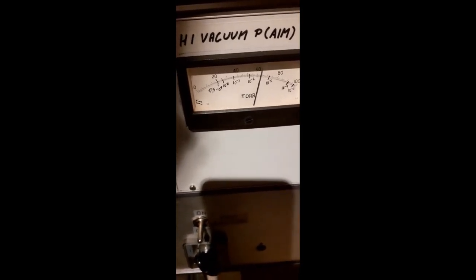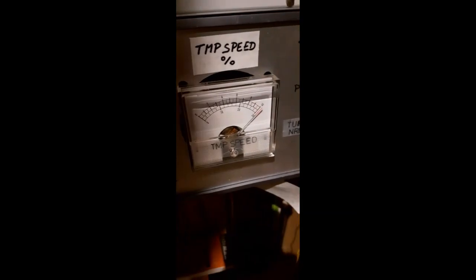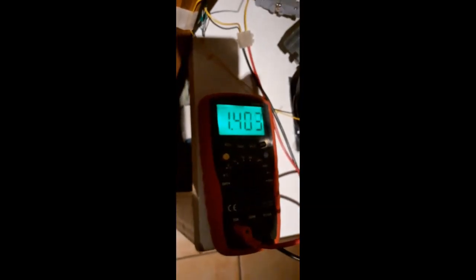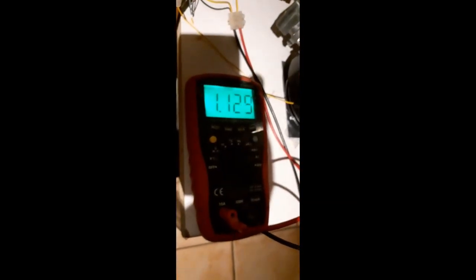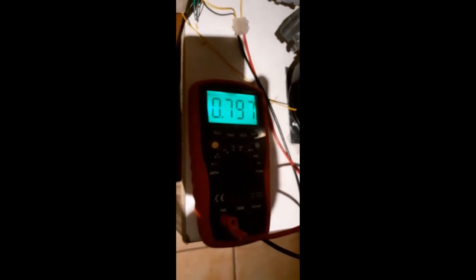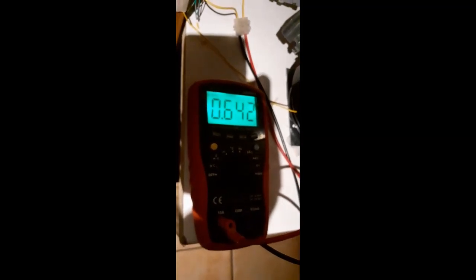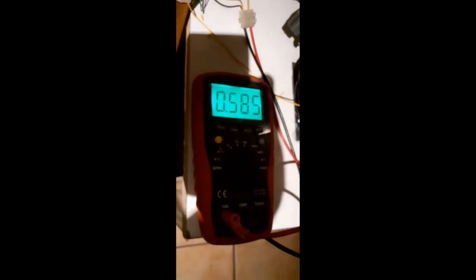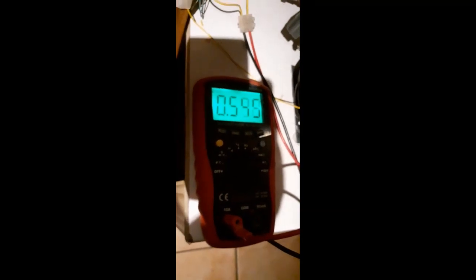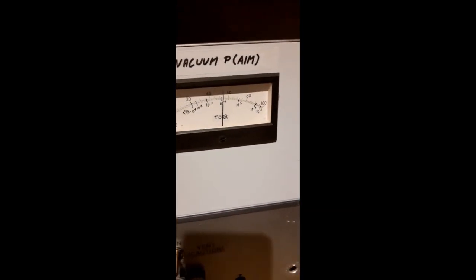And pump speed is already up to about 100%. Power draw is now rapidly declining, which is good. The fact that it gets up to speed this fast is pretty impressive. I've never seen that before in a turbo. I think it's because the chamber is so small. And the pressure has reached approximately 10 to the minus 6 torr.